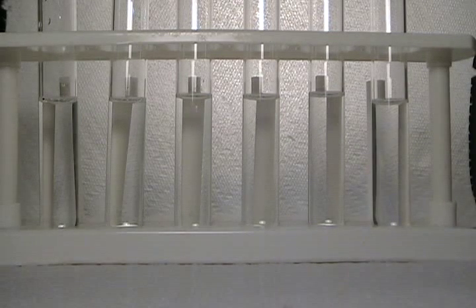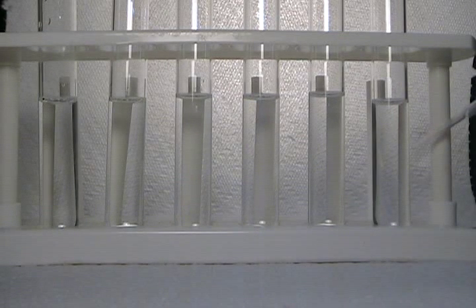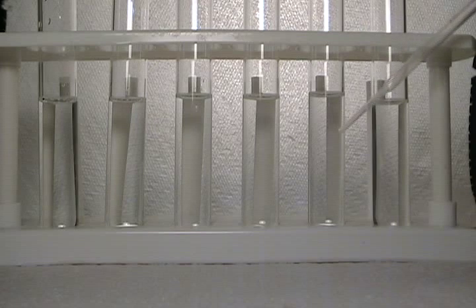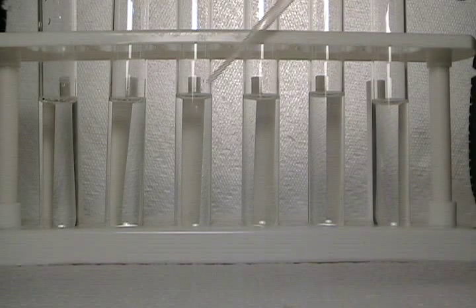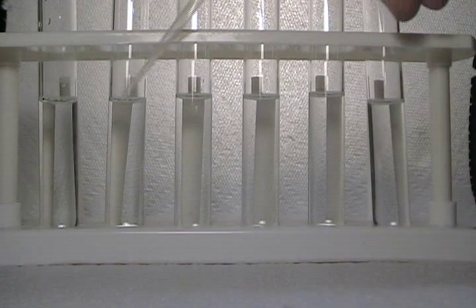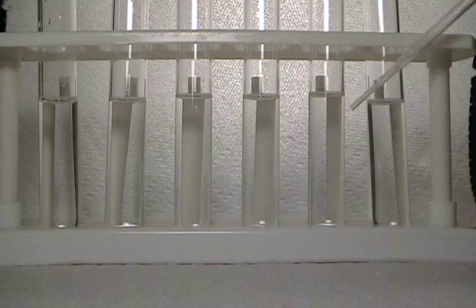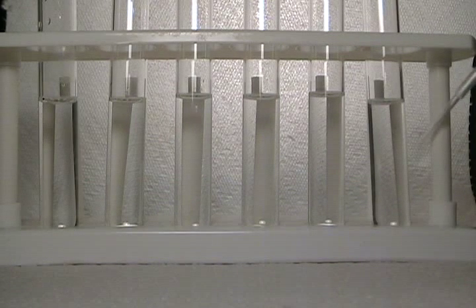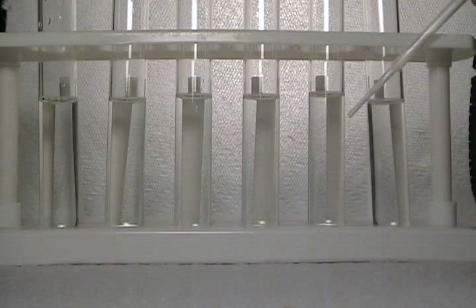I've made up the salicylate standard. The tube on the right contains 150 mg of salicylate ion per deciliter, and then I've done a serial dilution by halves: 75 mg/dL, 37.5 mg/dL, about 19 mg/dL, and about 9.5 mg/dL. The three rightmost tubes — 150, 75, and 37.5 mg/dL — are all toxic levels of salicylate ion. For example, at 150 mg/dL you have an emergency situation requiring kidney dialysis, and the same applies at 75 mg/dL.